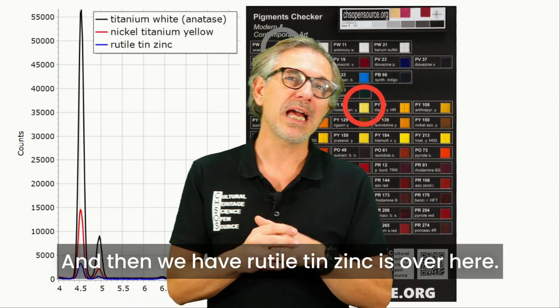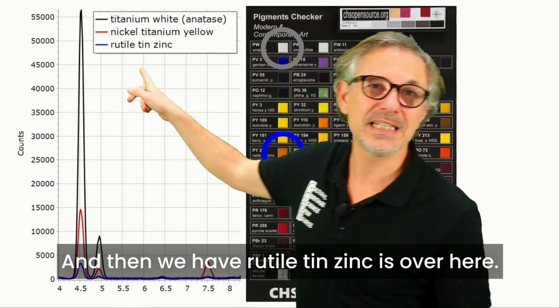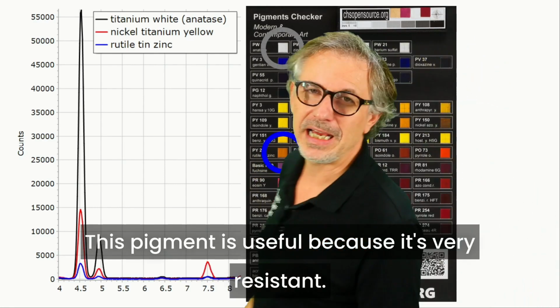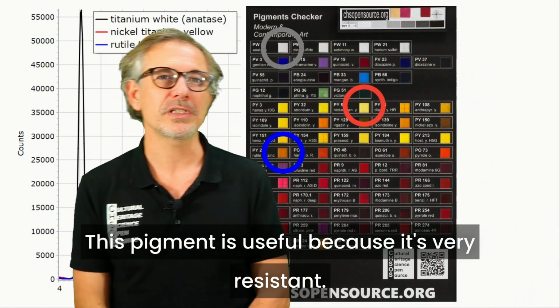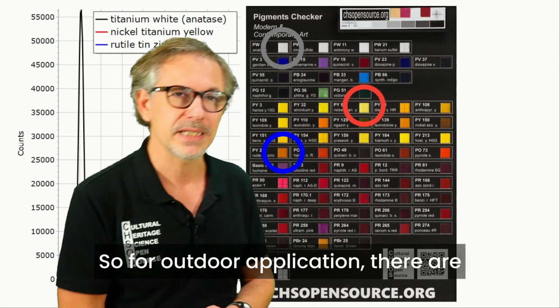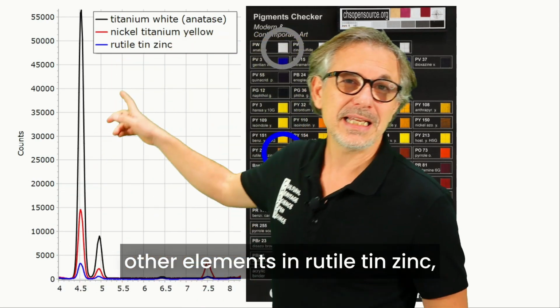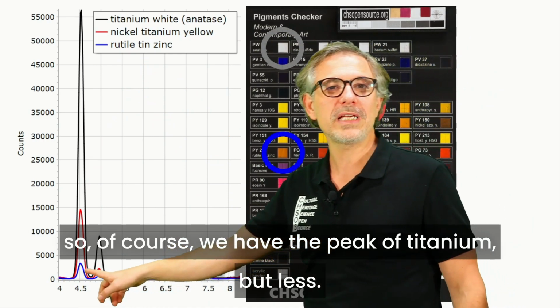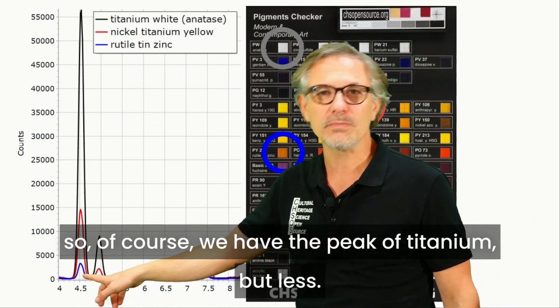And then we have rutile tin zinc over here. This pigment is useful because it's very resistant, so good for outdoor application. There are other elements in rutile tin zinc, so of course we have the peak of titanium but less.